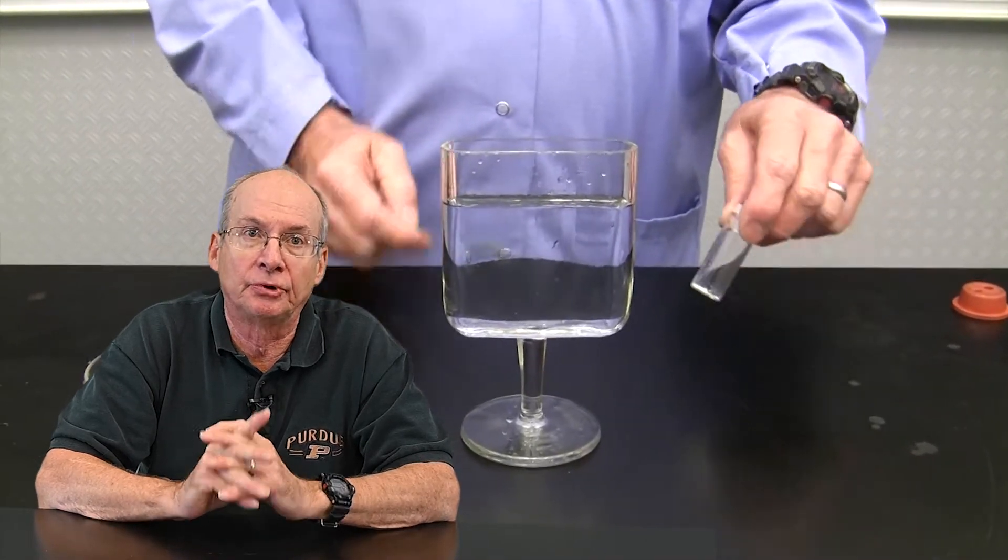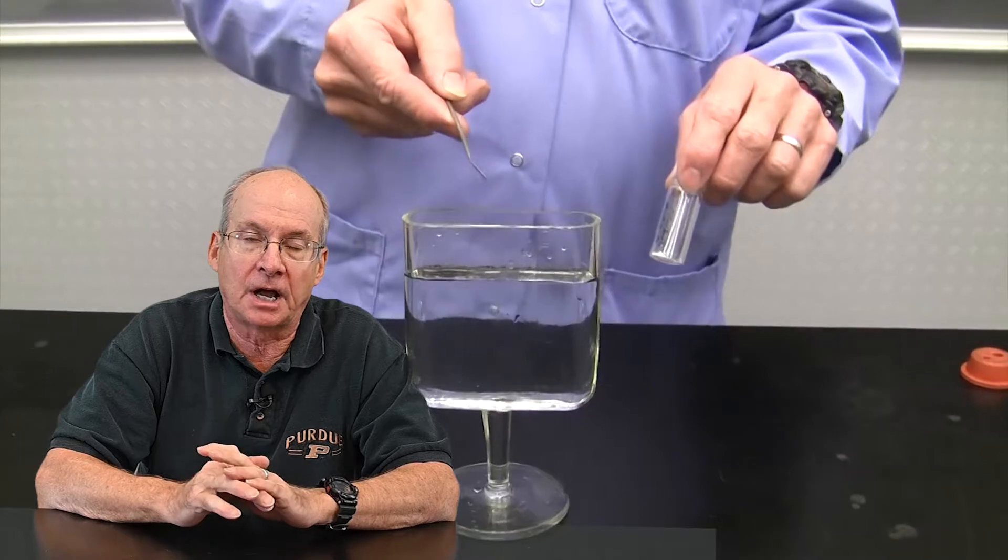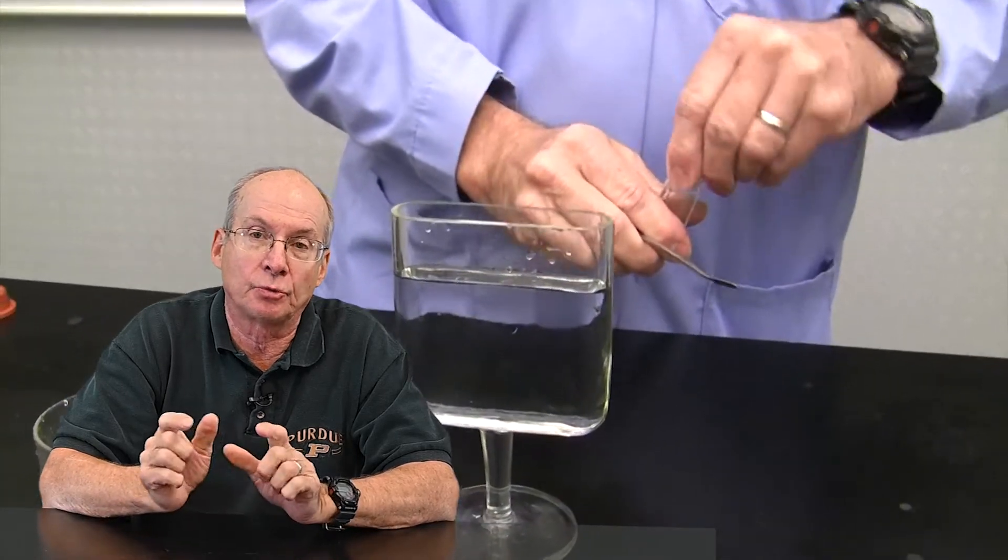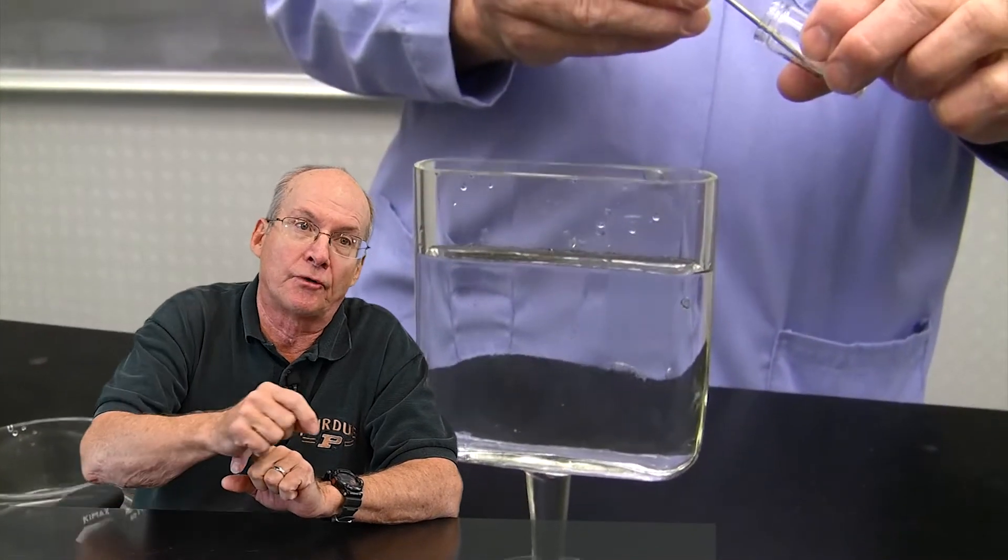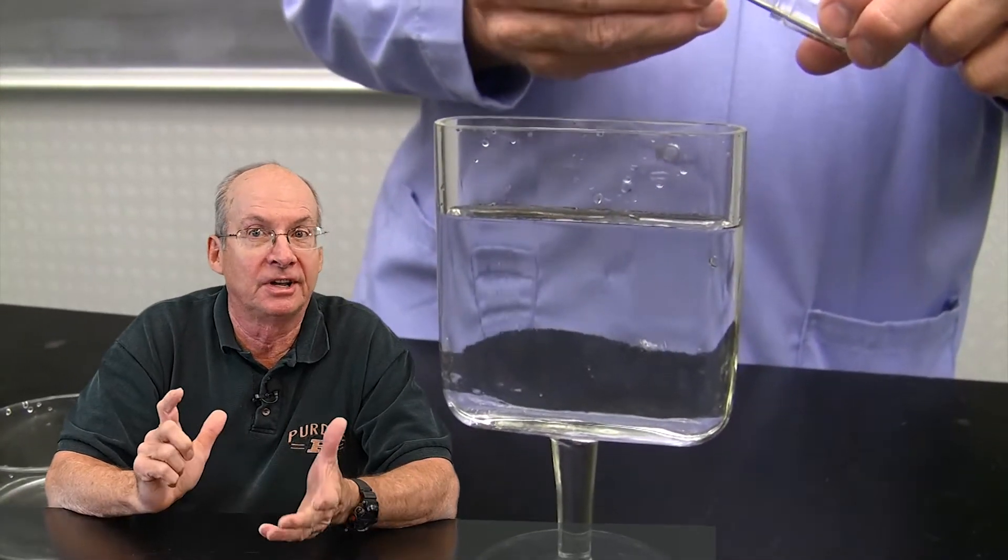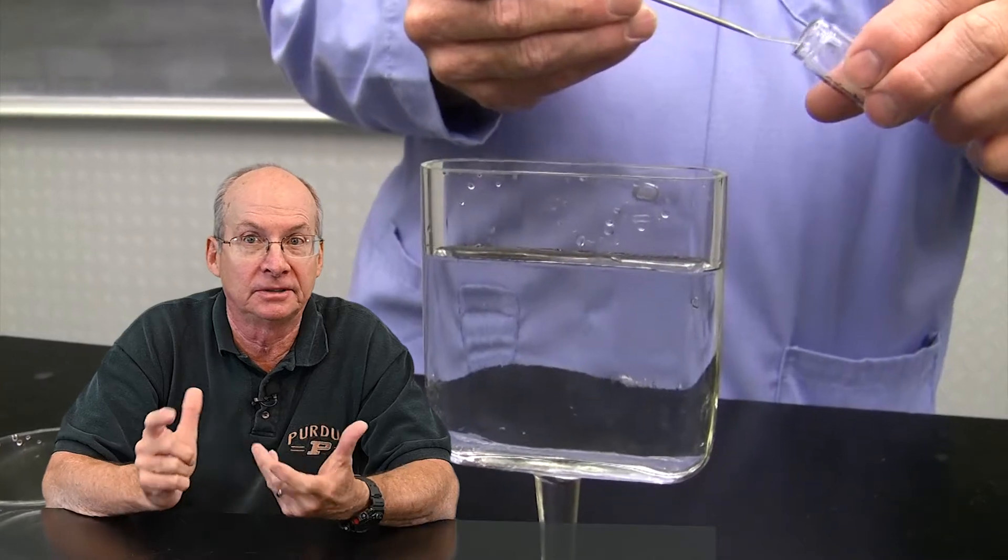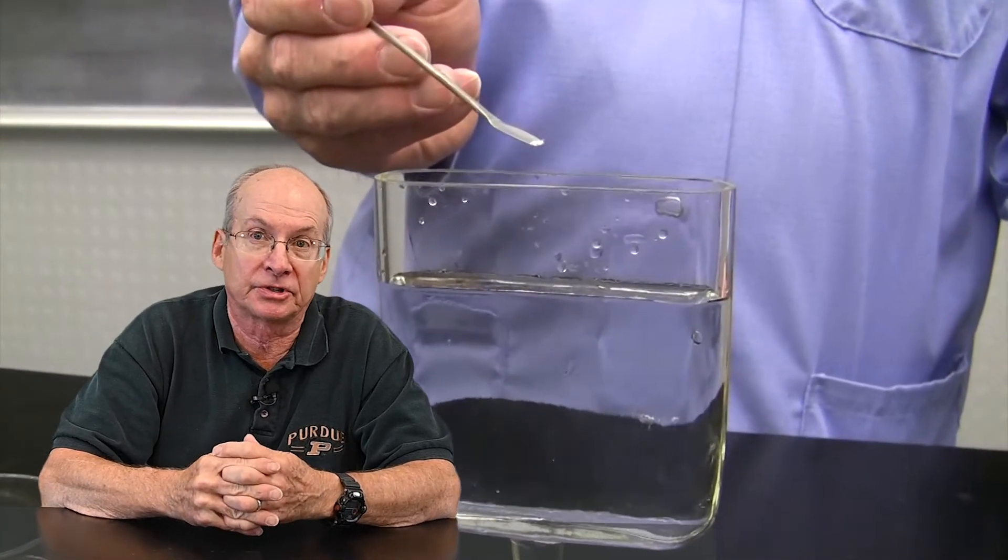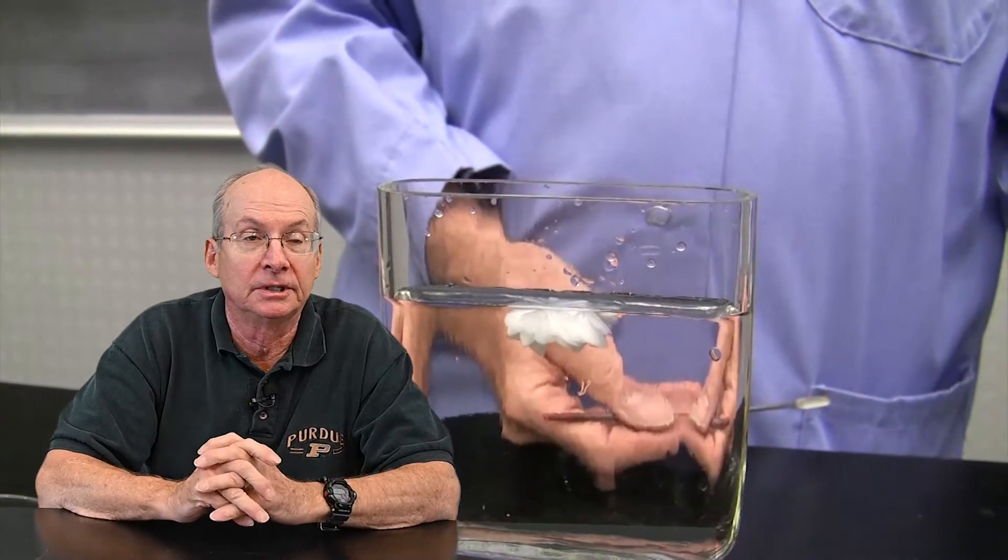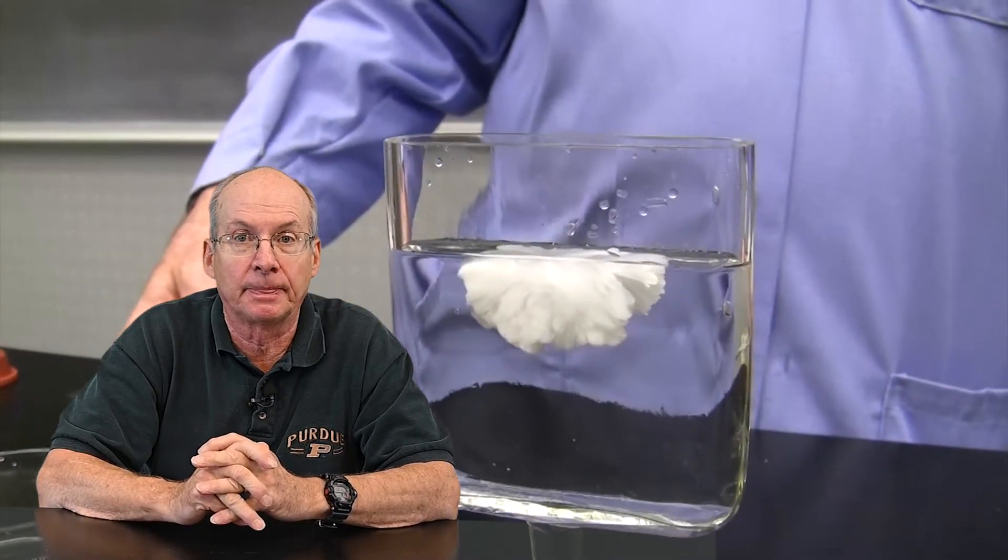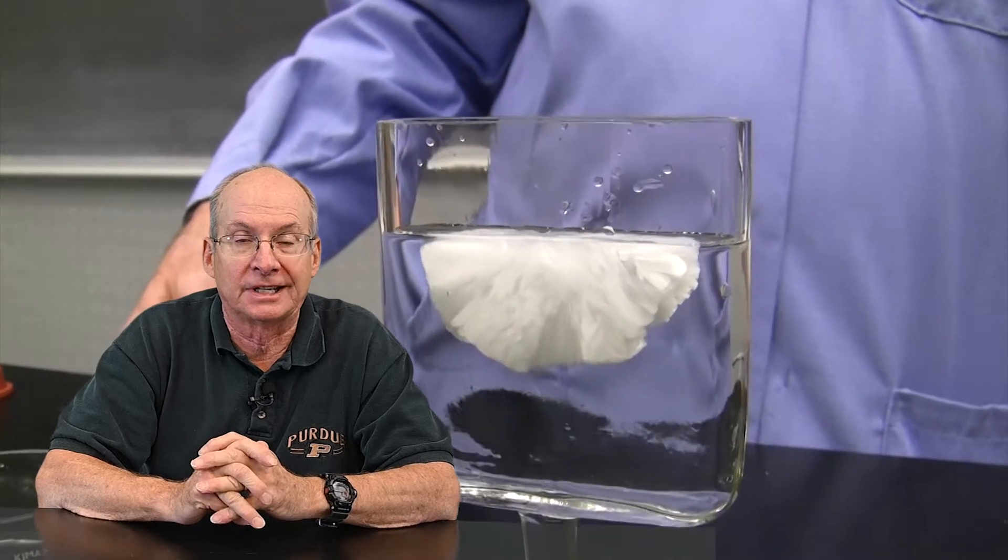So the key is rinse well with clean deionized water before you transfer, and then I always wet down the surface which I'm pouring out of so it doesn't go over any dry surface, just in case there's some speck of something you don't see there, because it just takes a crystal, literally a crystal of this compound or some other pollutant, to seed the reaction and start the process of crystallization.